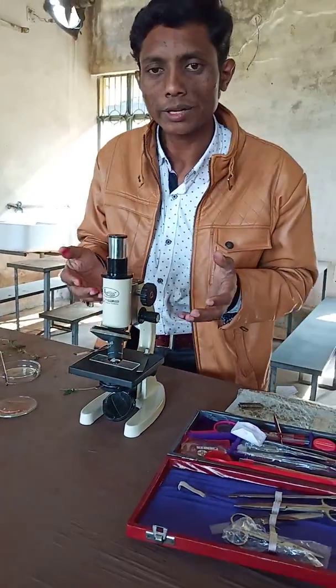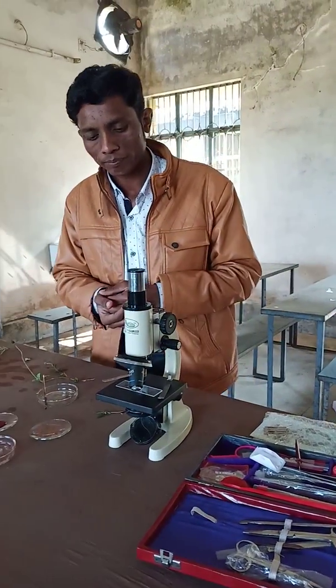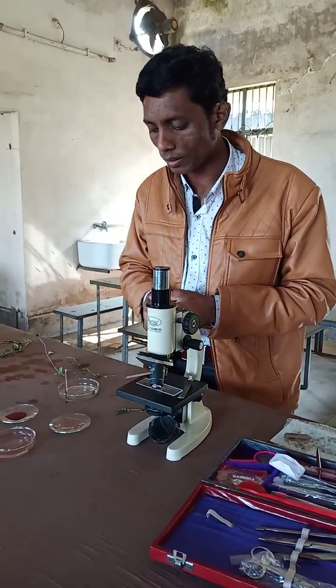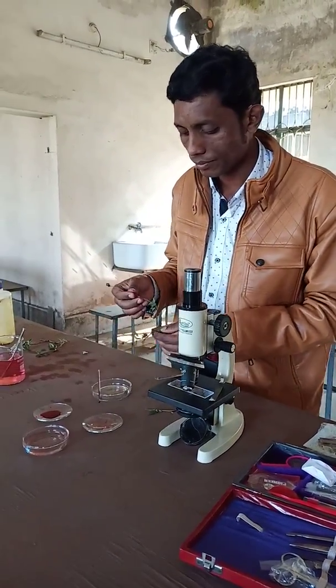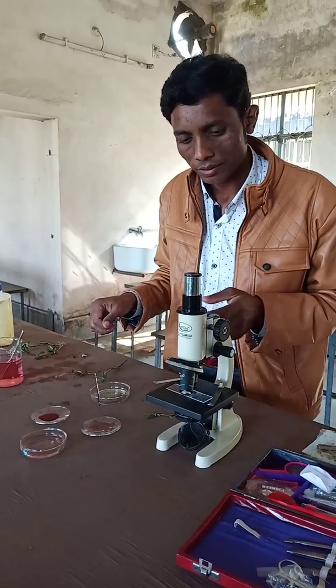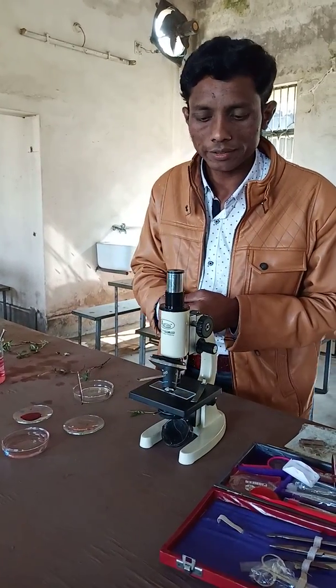Here we can observe the TS of the section of Tridax Procumbens on the slide, and through this eyepiece you can see and observe the transverse section.